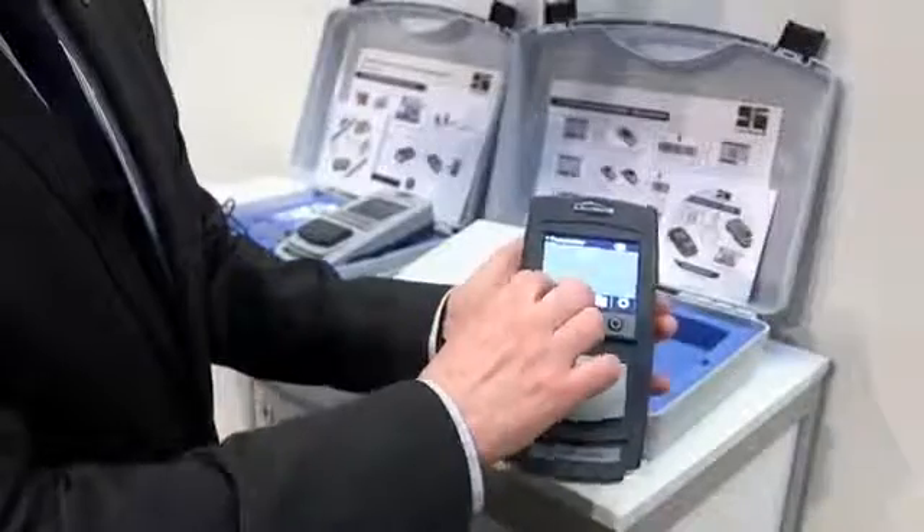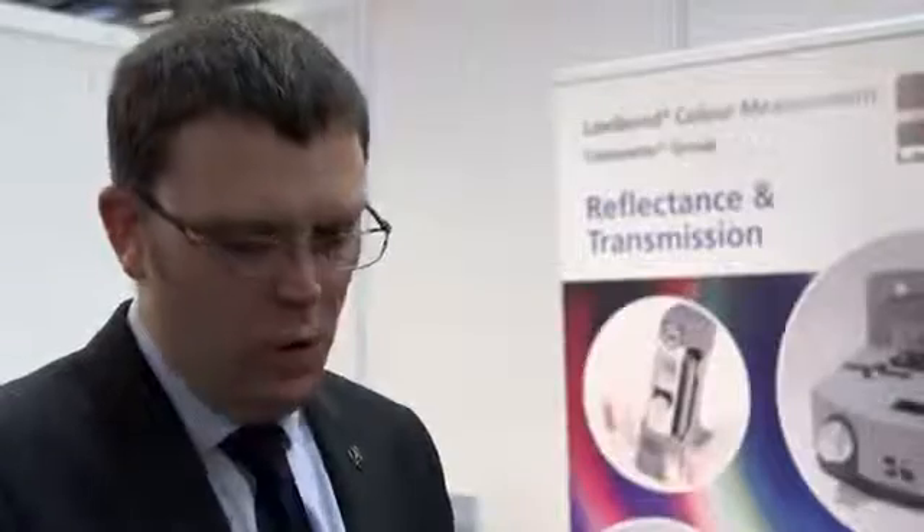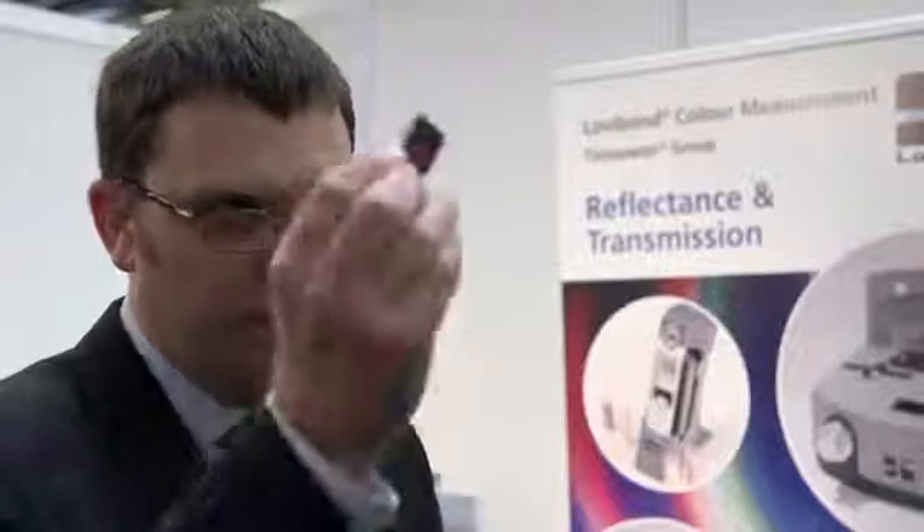To take a reading I can simply take my cell with my liquid in it, position it carefully — it's held tight by a metal clip very securely — pop that down and press the read button, either on the button or on the screen. Or if I want to check my reference standard, I can remove my cell. It's impossible to put that in incorrectly. I can pop that in and simply press read, and it takes about 15 seconds to take the reading.